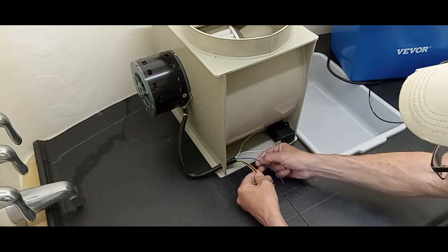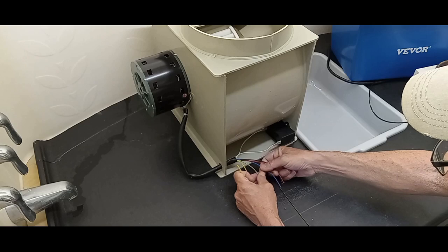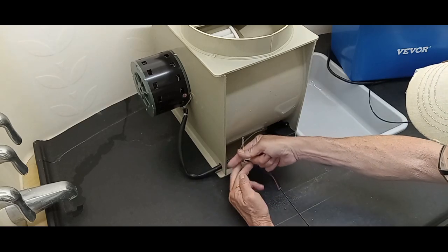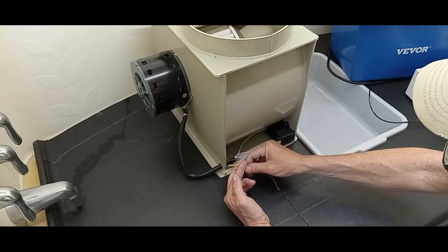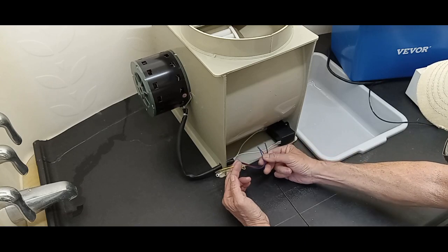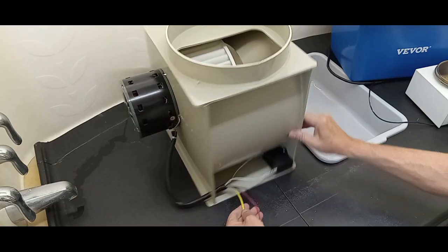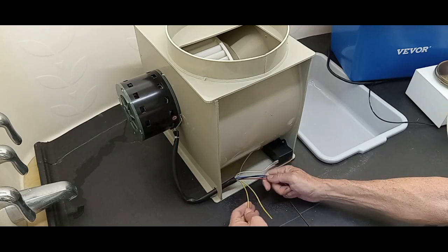So there's a 20 mic cap. There's your ground. There's your hot. And there's your speed control. So black, blue, red.